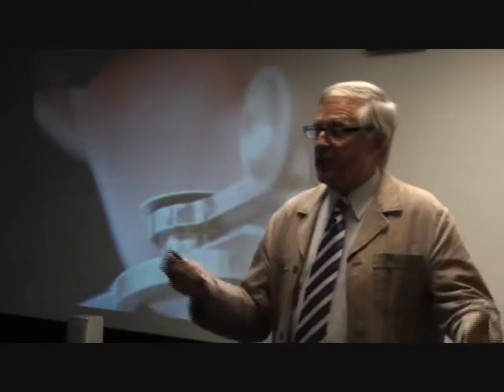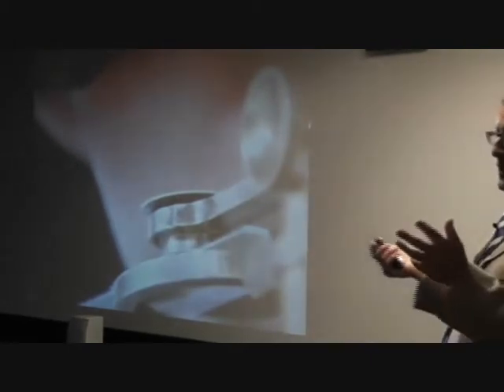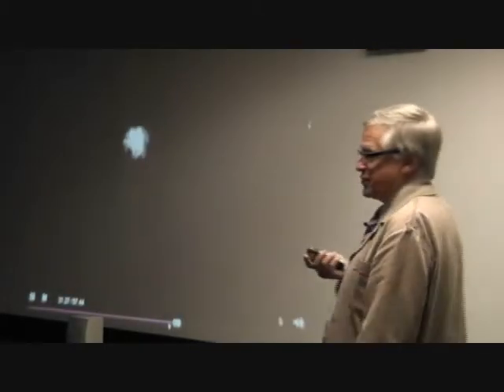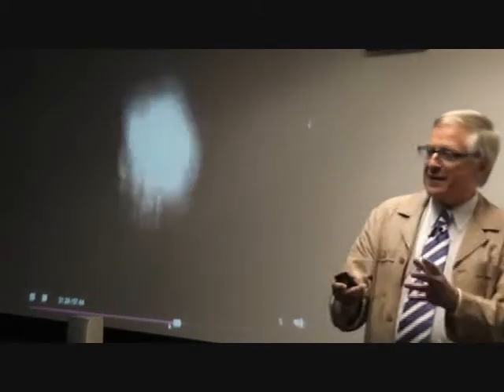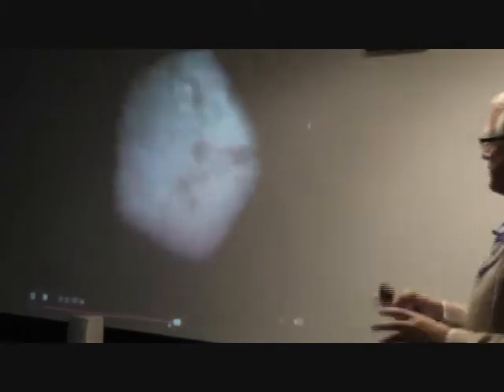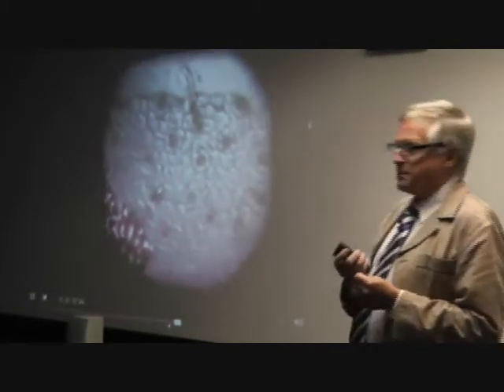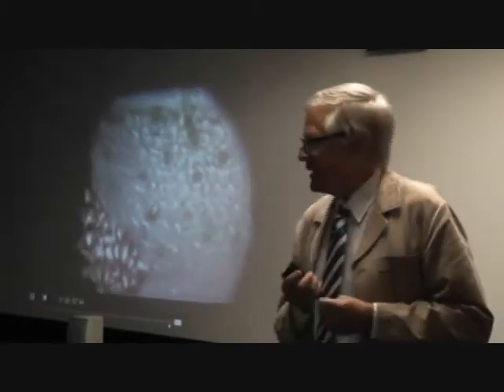I was astonished. I thought, well, it's so easy to do. At least I didn't find it very difficult. But this is what they managed to achieve. Here comes their technical wizardry, their top cameraman, their leading microscopical expert. And this, ladies and gentlemen, is what goes on the television program as an example of what Robert Brown could see through his microscope.